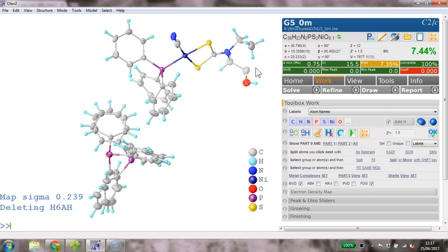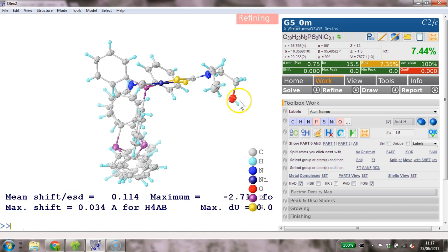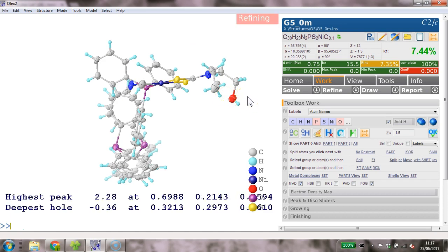So basically we need an AFIX, an HADD 23 here. So this is how you add a specific one in OLEX2, and we refine this again. And that should all behave quite well.